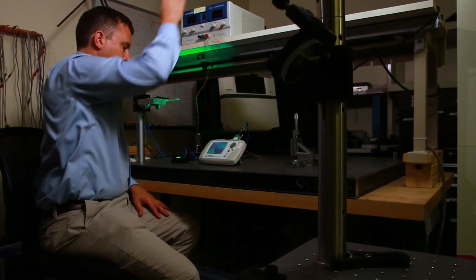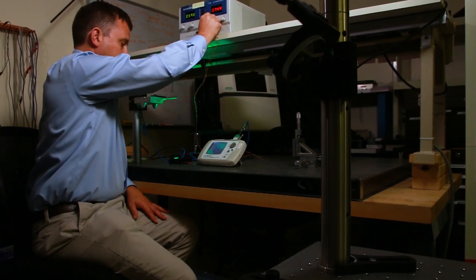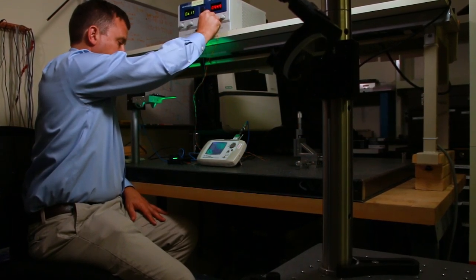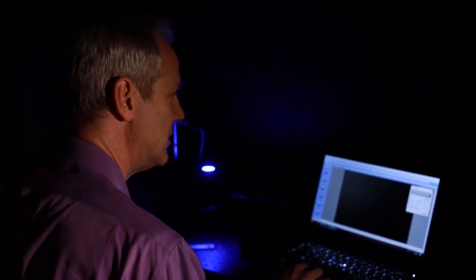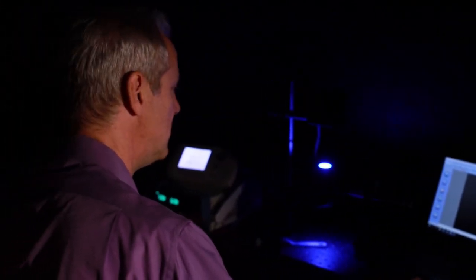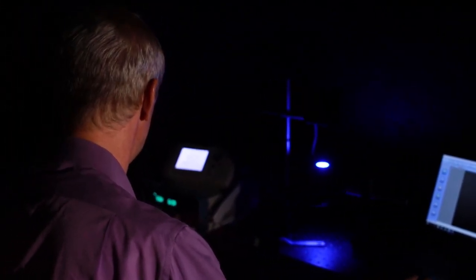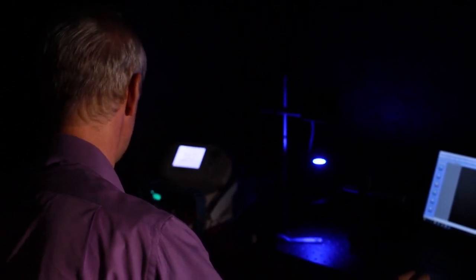We considered lasers. We ended up choosing LEDs. If you filter an LED properly, it behaves a lot like a laser, and LEDs are known to be extremely reliable sources, very stable. Lasers can struggle from speckle problems, but the biggest advantage of an LED, in my opinion, is the sheer amount of power you can get from these devices.